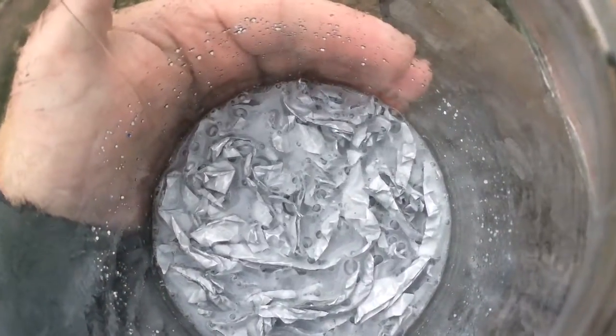So we're really starting to see the breakdown of the aluminium now, and if we compare to earlier in the video, it's becoming like a grey slurry, and that's the aluminum mixing in. Now I'm just touching the jar. Now it's starting to get a little bit warm, but I know it can get a lot hotter.